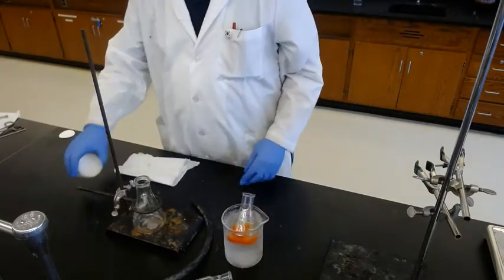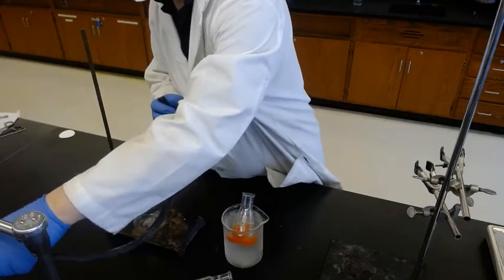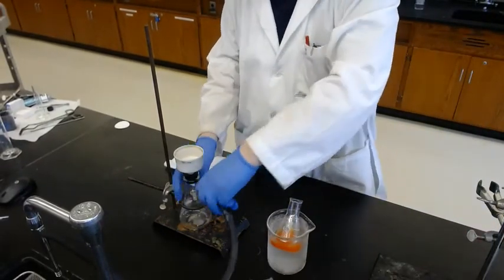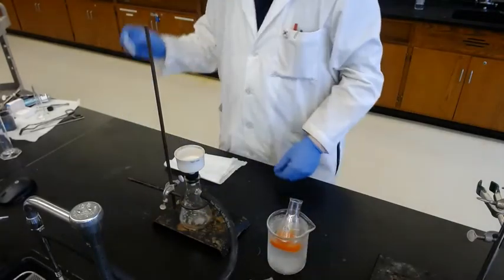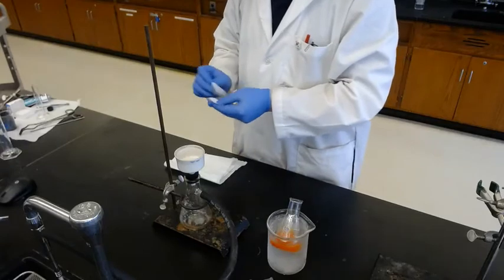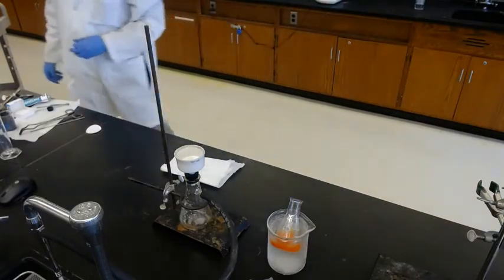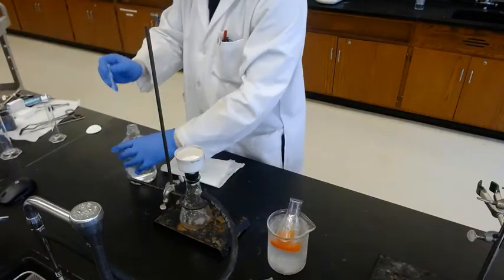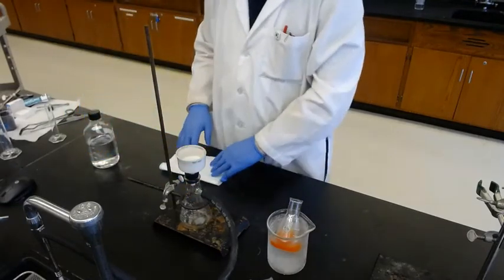The product was cooled to room temperature and is now in an ice bath to precipitate more product. We have to do vacuum filtration again. Connect one end of the hose to the water tap and the other end to the side of the suction flask. Turn on the water all the way. Put the filter paper in the Büchner funnel and wet the paper with ethanol to keep it tight. Everything's ready.